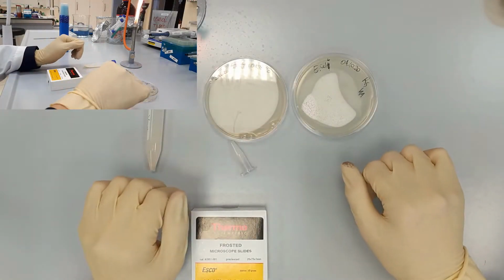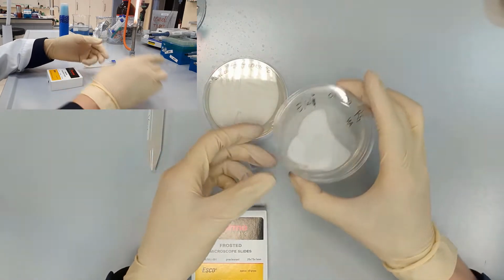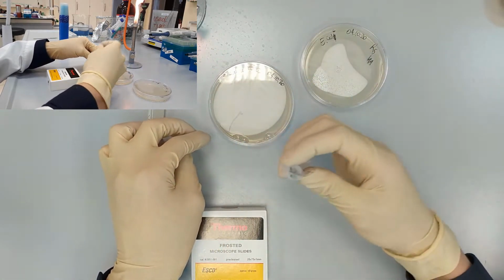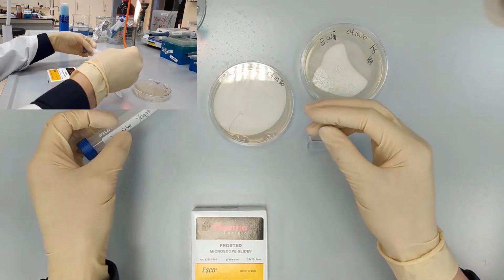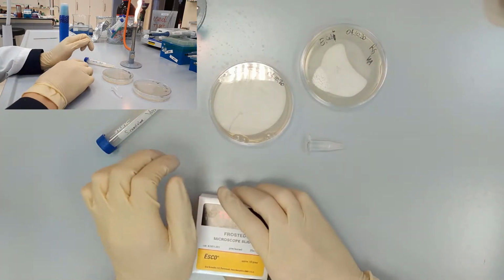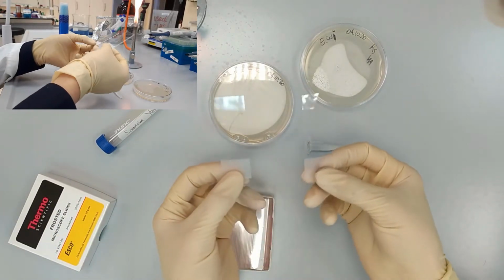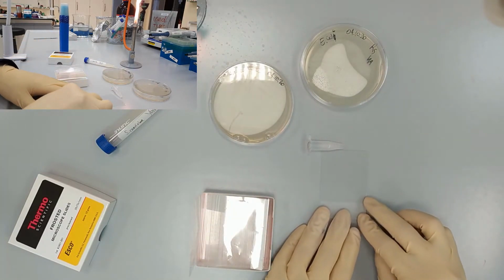Today we have the microscopy lab, and we are going to use two bacteria, Escherichia coli and Staphylococcus aureus, the mix of bacteria, the yeast, and a part of onion skin. So for that we will need 5 slides like this, and we are going to label them first.